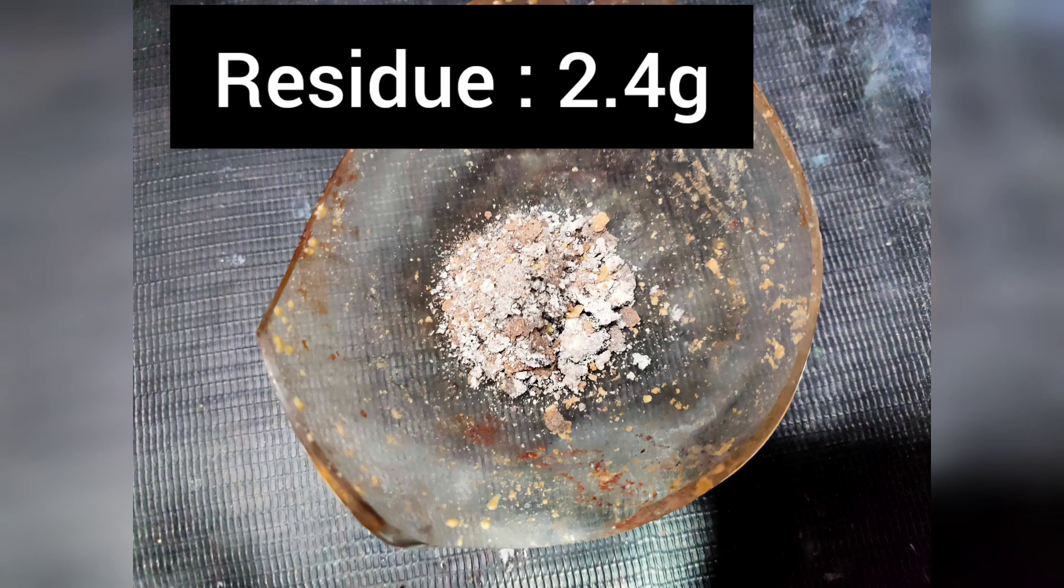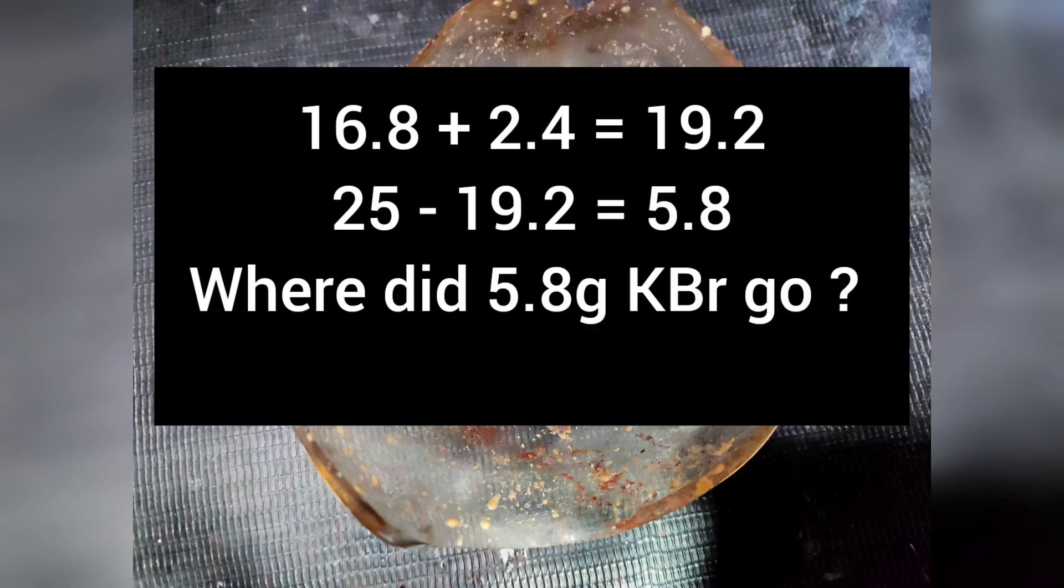So the question is, where did the 5.75 gram of potassium bromide go?